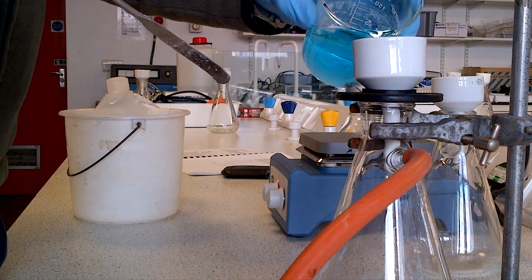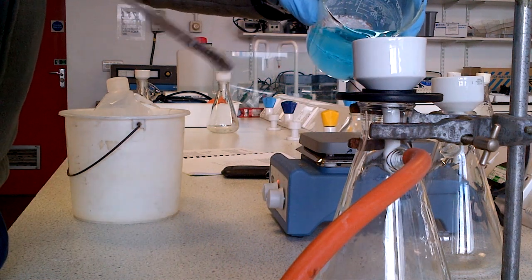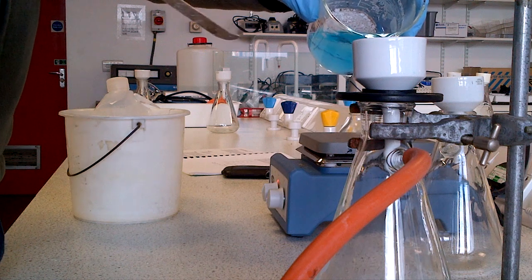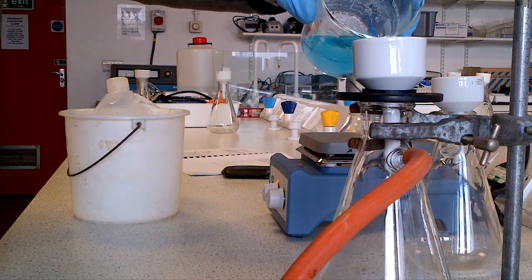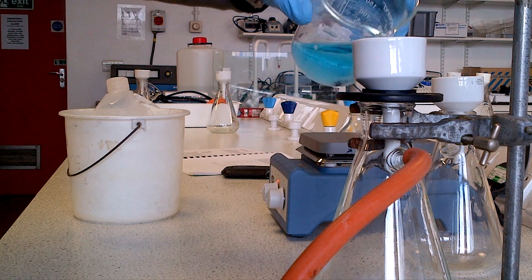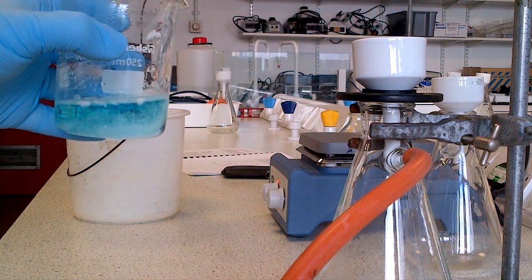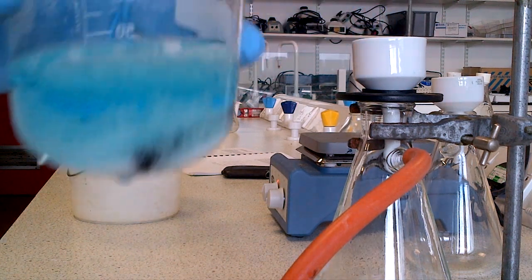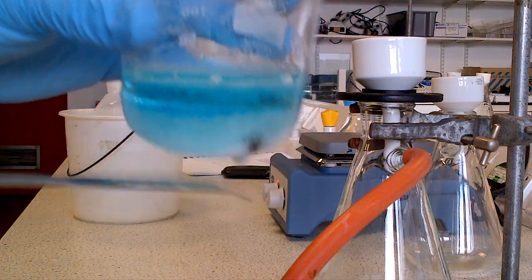While in position, you're now free to actually start to filter off the crystals of salicylic acid. You pour out as appropriate and you'll have crystals of salicylic acid in here.